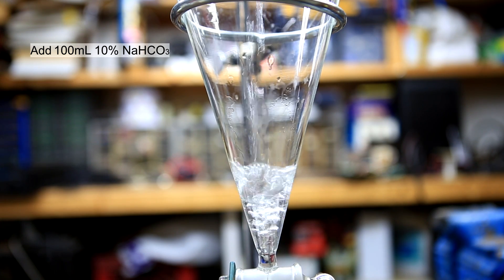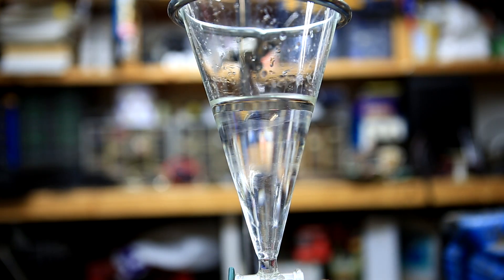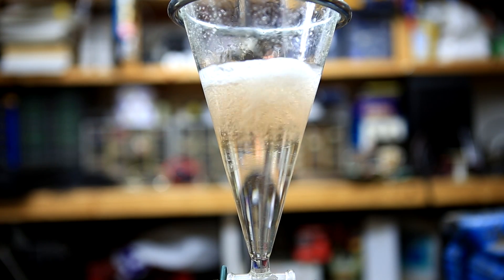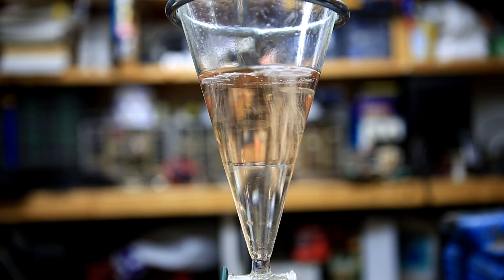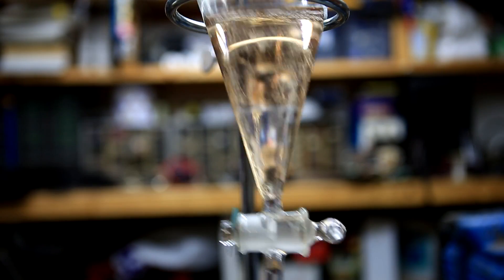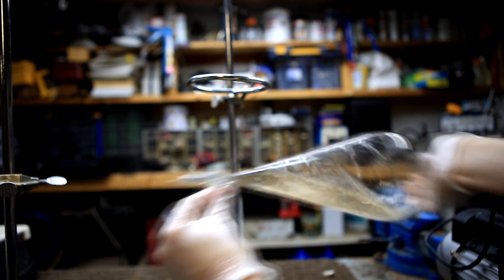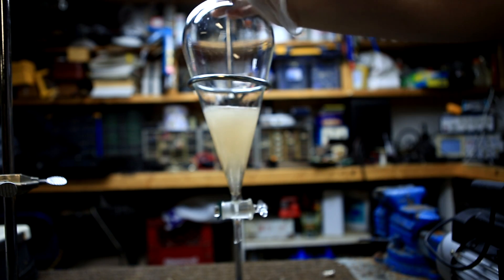To a large separatory funnel was added 100 milliliters of 10% sodium bicarbonate solution. Once the reaction mixture was only warm to the touch, it was added to the separatory funnel. Immediately upon addition, the sodium bicarbonate reacts with the unreacted anthranilic acid as well as the sulfuric acid catalyst. The mixture was given a few minutes to react and settle down, and the round bottom flask was washed with a small amount of sodium bicarbonate solution. The separatory funnel was swirled to mix the layers, then capped, shaken, and vented frequently.